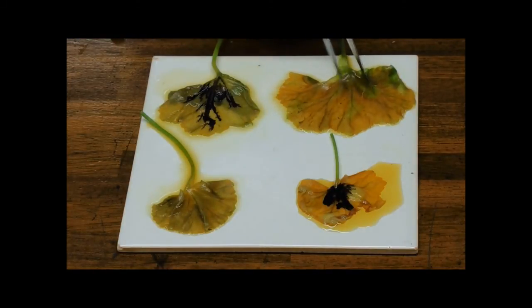Here, where it's been in the dark, we've got absolutely no starch synthesis at all. Showing that light's absolutely required for photosynthesis.